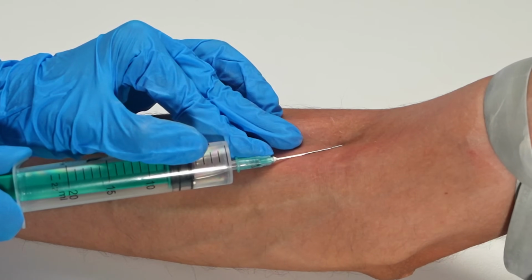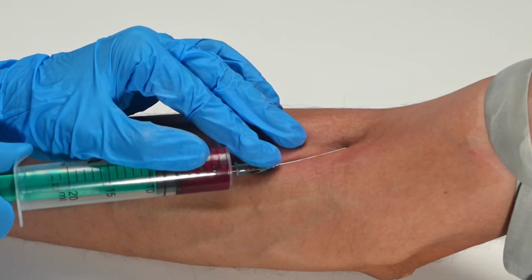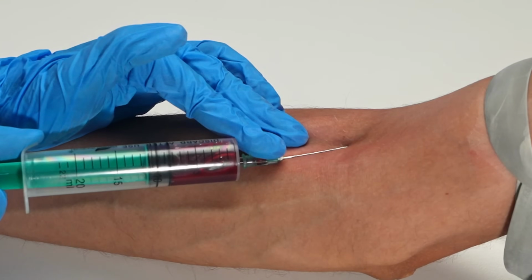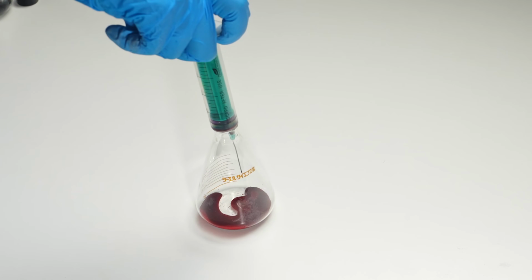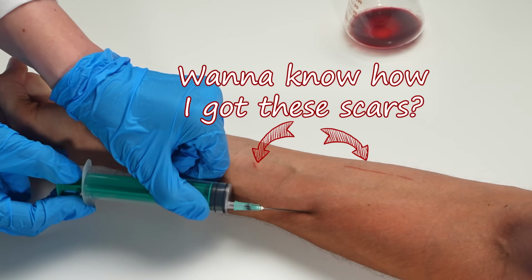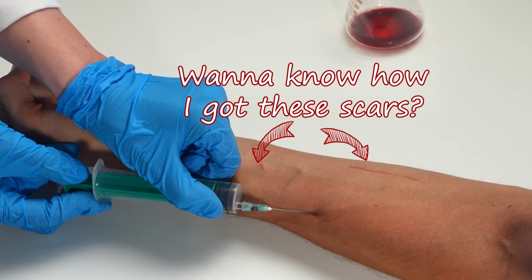Venous blood has a dark red color with a bluish tint. This blood is poor in oxygen and is darker than arterial blood. I'll store the collected blood in a conical flask. Since heparin is already present in the flask, this time I can collect blood without it.